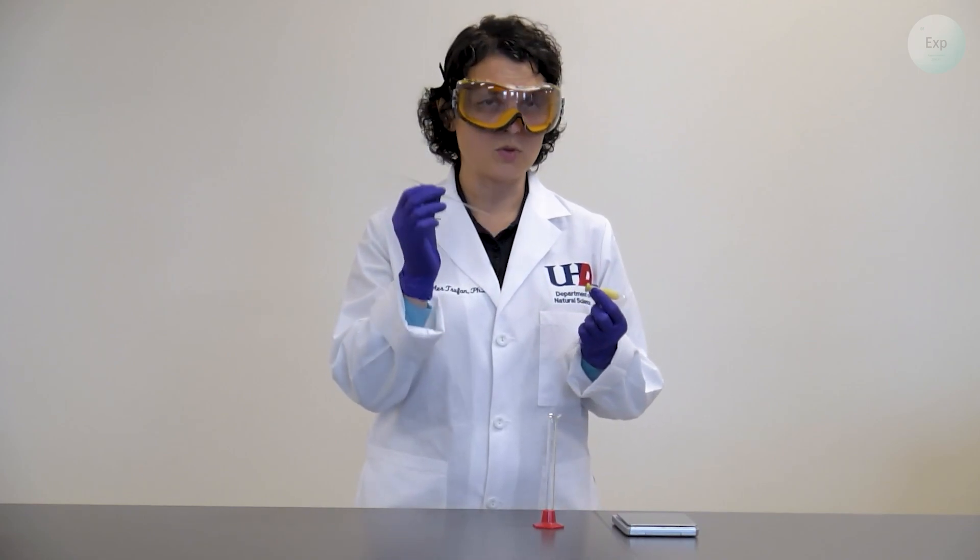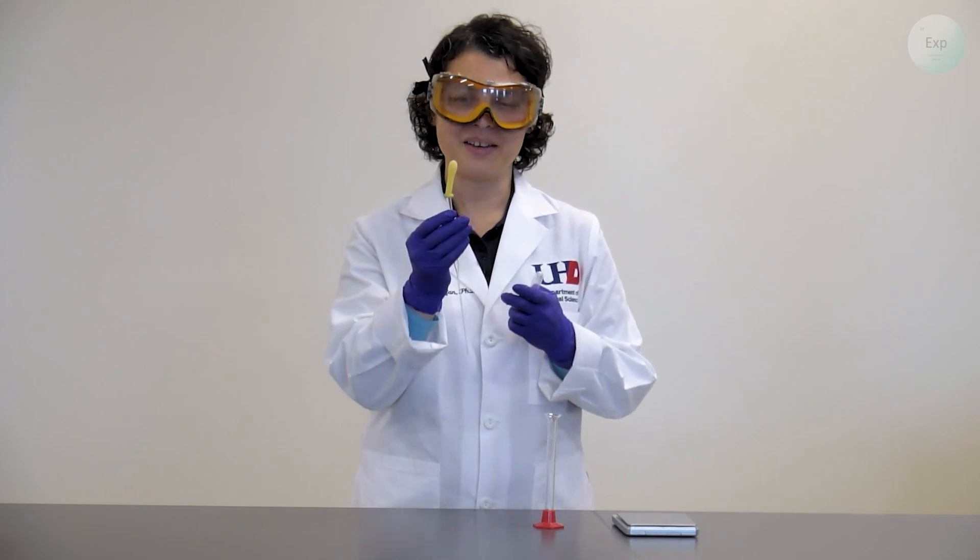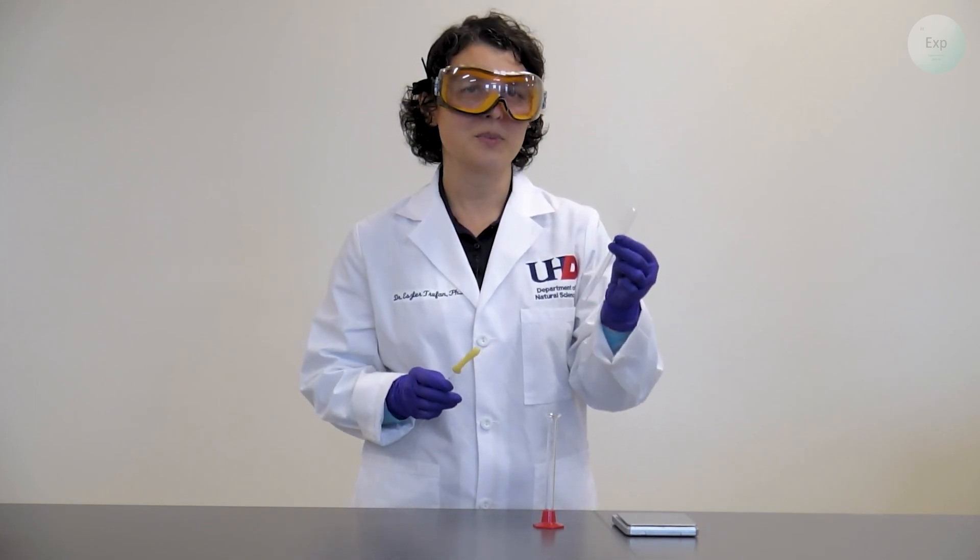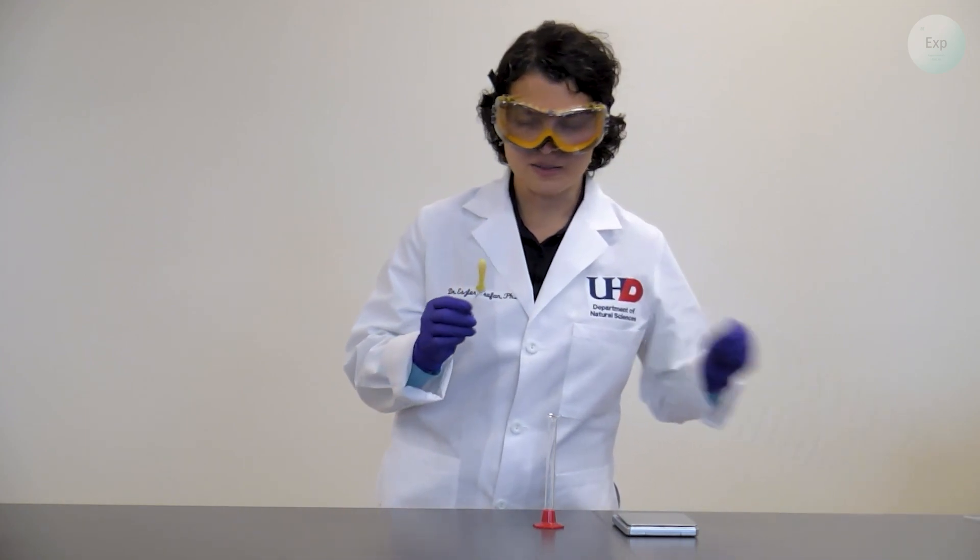We can either use a disposable Pasteur pipette with a pipette bulb, and it would look like this, or we can use a disposable plastic pipette. I prefer the Pasteur pipette for the experiments today.